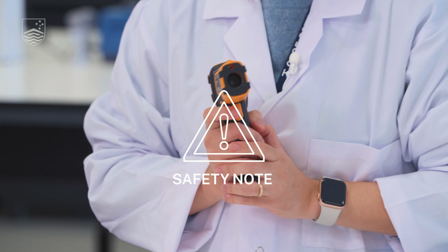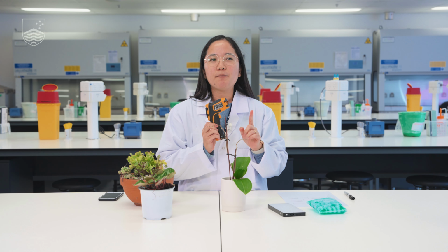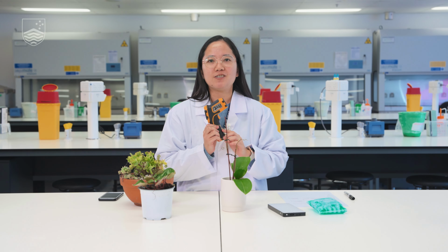Now with this laser, I think it is important for me to take note that you shouldn't point it to your friends, especially to their eyes, because this laser is only for measuring temperature, and the laser might be dangerous to point to each other's eyes.